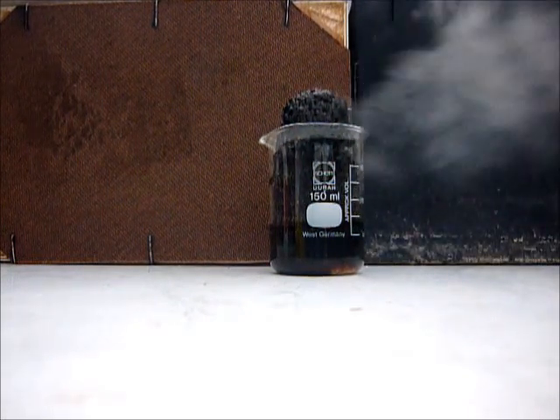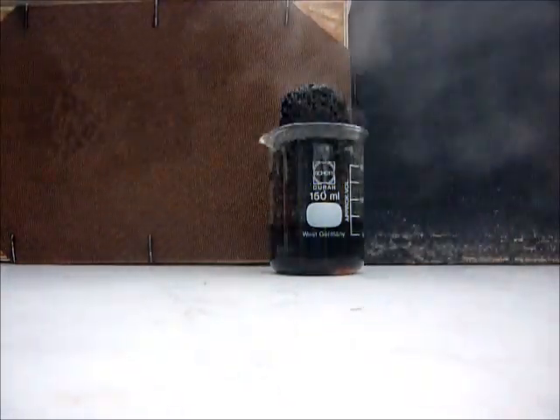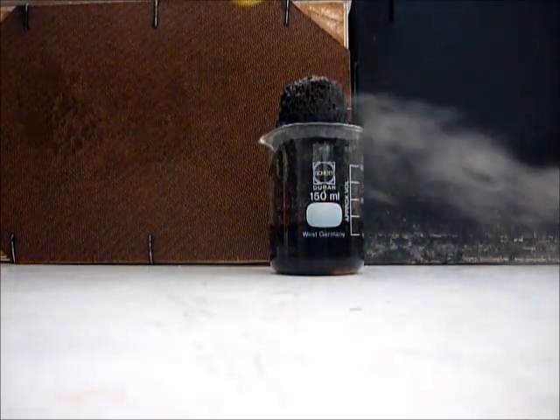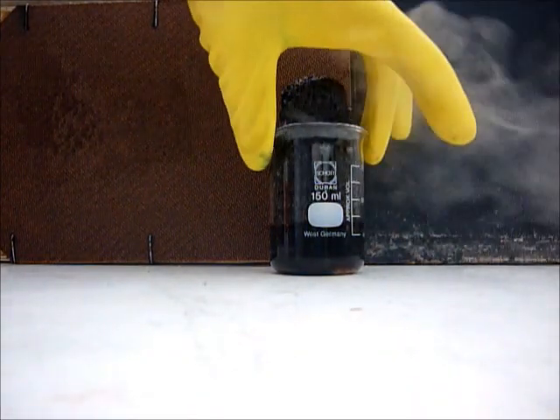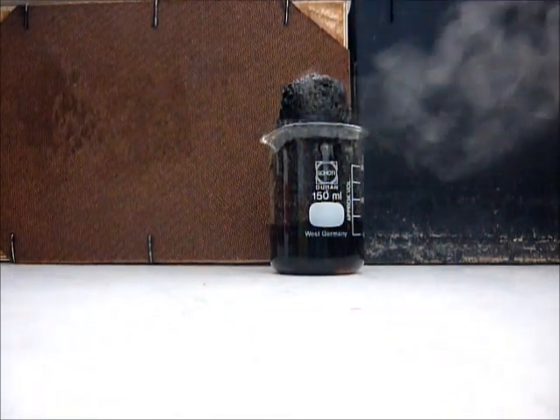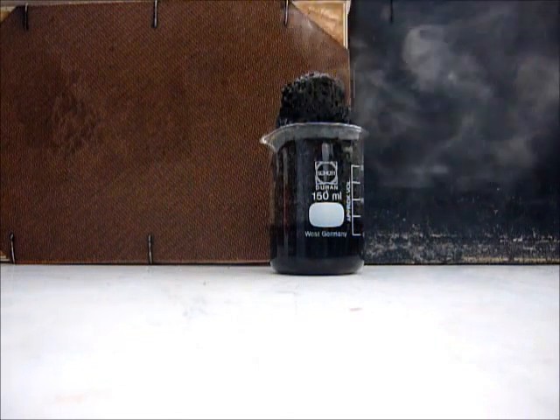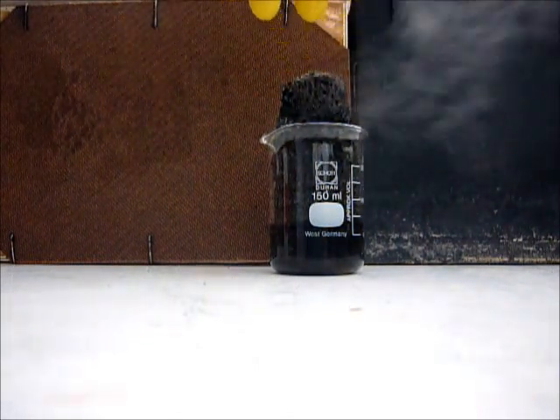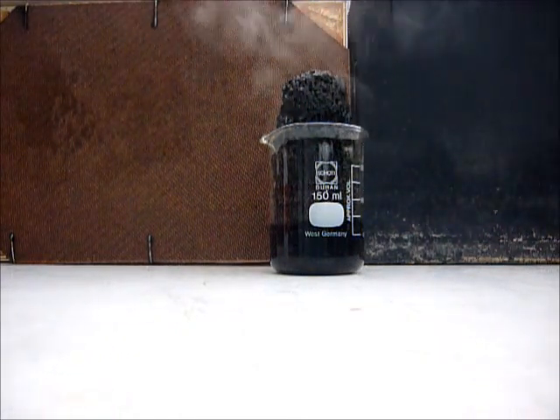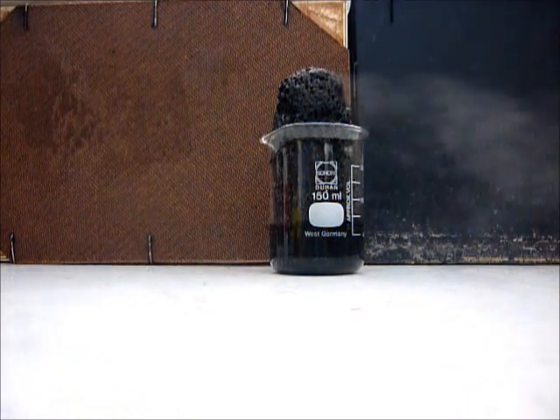To clean the beaker is really messy. This is a big trouble after this experiment because the whole beaker is dirty from the carbon left. This is pure elemental carbon, okay with contaminants of sulfuric acid and sugar and a little bit of water, but this is very pure carbon.